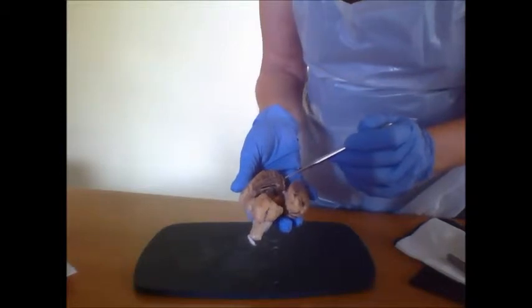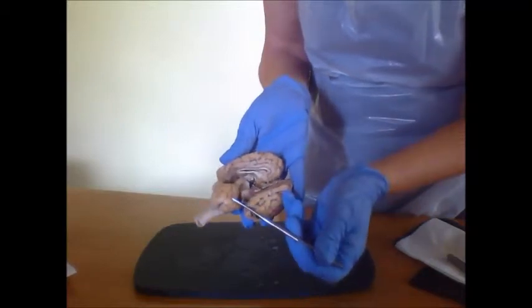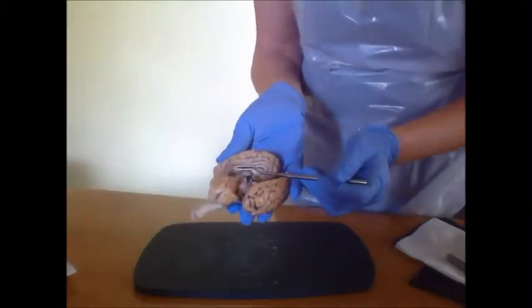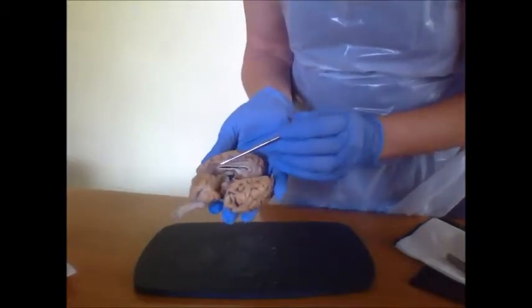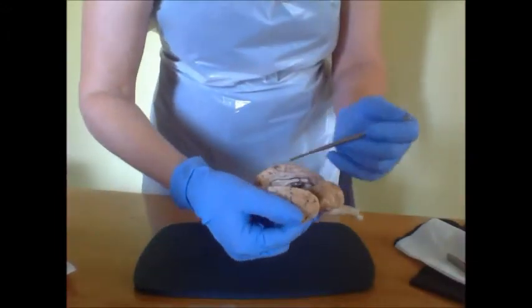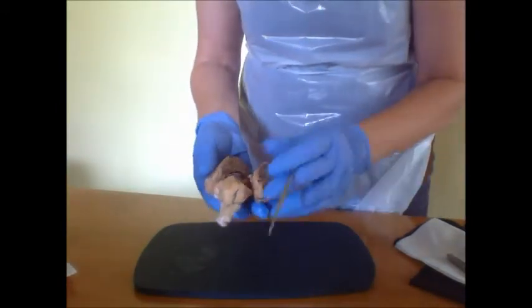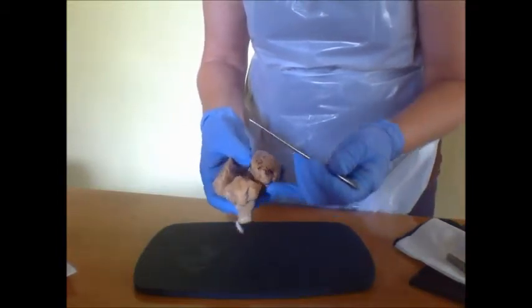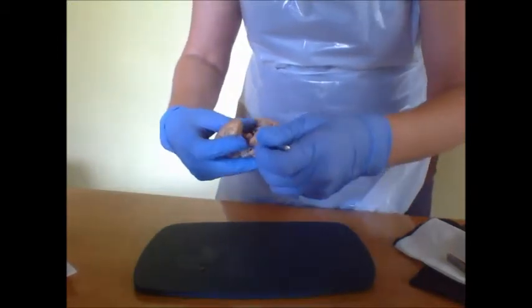Then we would also have, looking sagittally at the brain, the cerebellum, and this open space would be the fornix. The corpus callosum would be in through here. You can also view that a little better here. And then we would have the lateral ventricles, both sides. Now, the lateral ventricles will be in there, deep.